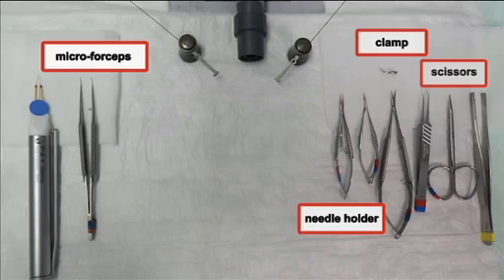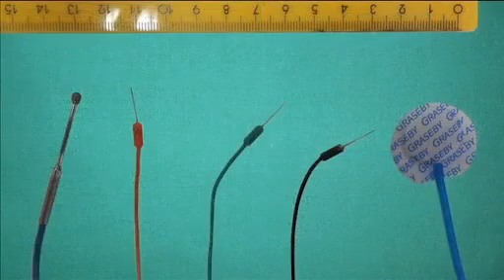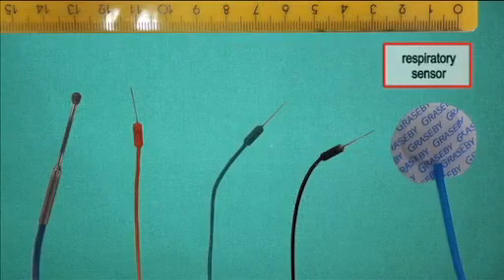Here are the instruments we need. Suture materials we need are 6-0 silk, 6-0 Prolene, 7-0 Prolene, 10-0 Prolene. This is the temperature sensor, ECG sensor and respiratory sensor.